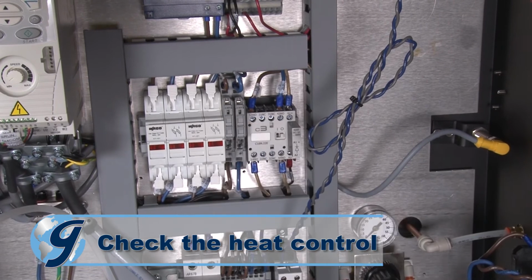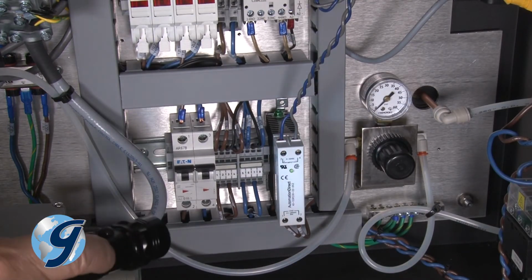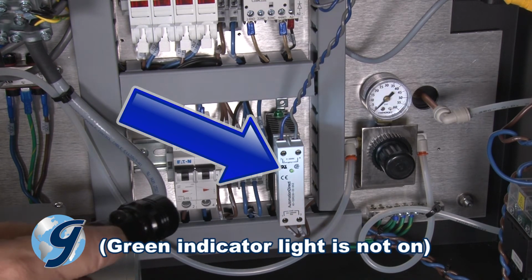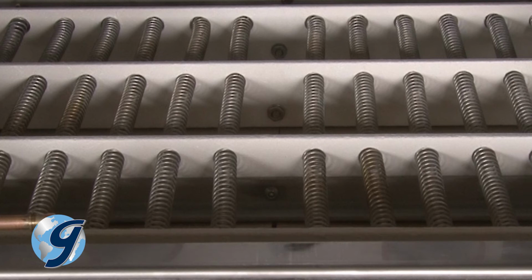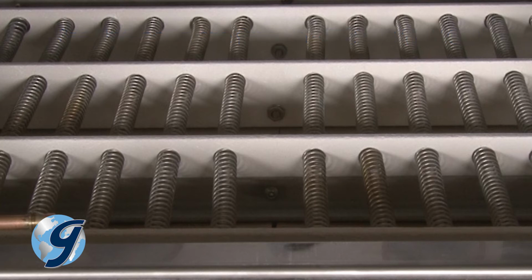If the unit still will not heat, you need to check the heat control. If working correctly, the heat control should have a green indicator light on. If the green indicator light is on, and the unit still will not heat, you need to carefully inspect the heating coils for any breaks. Note that the heating coils are very sensitive. Do not touch. A broken coil should be completely detectable without physically touching the coil.